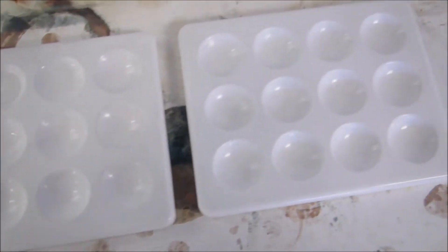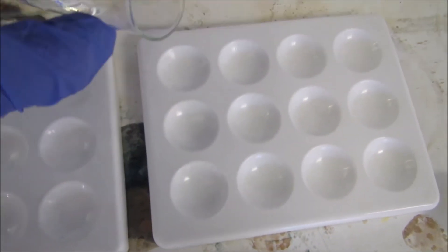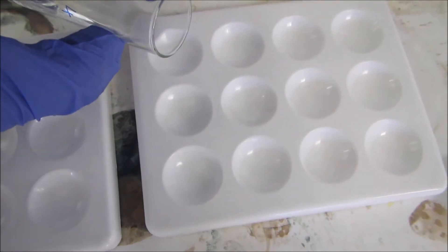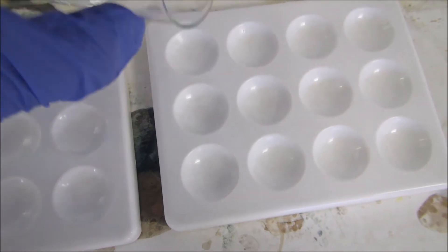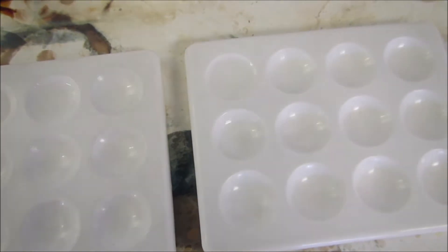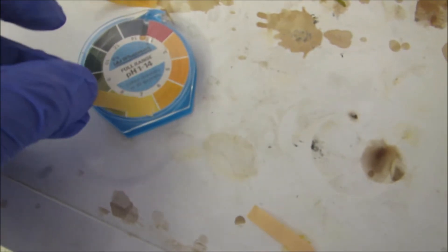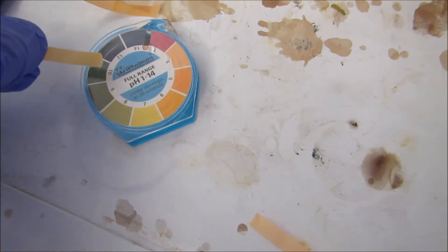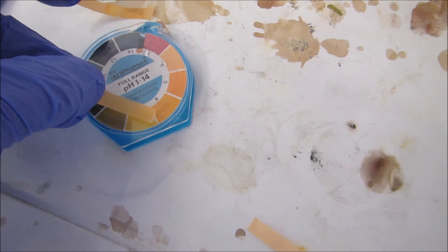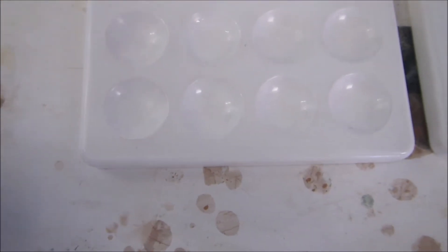Number four. I have to quickly measure it now because it evaporates very quickly. And finally, number five.